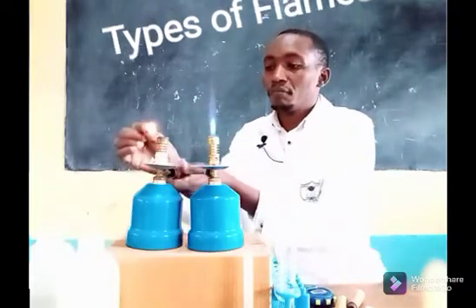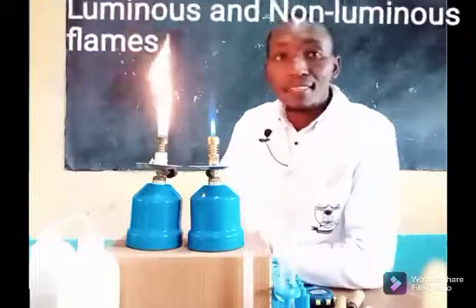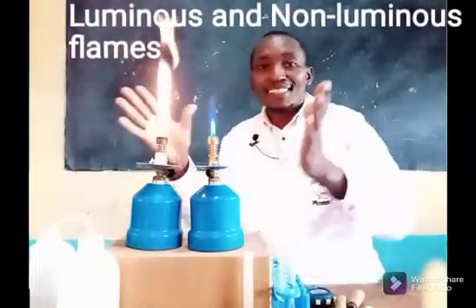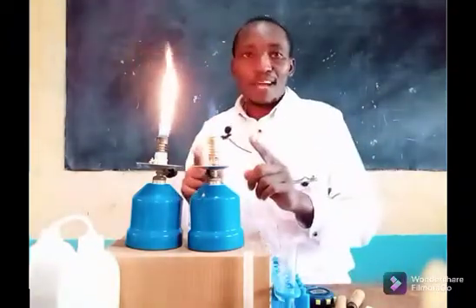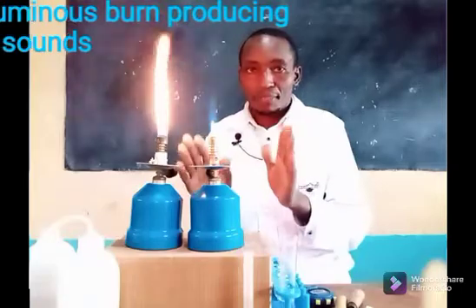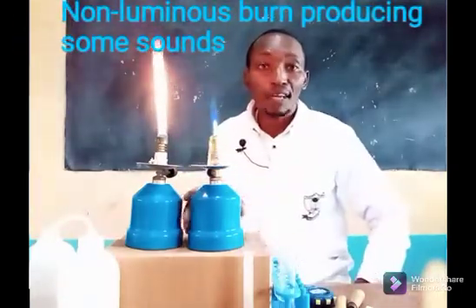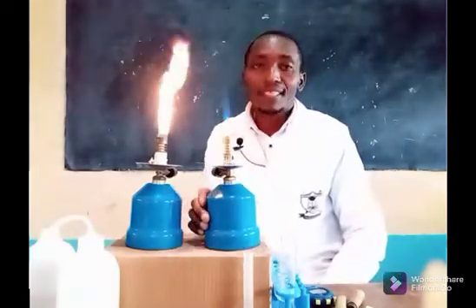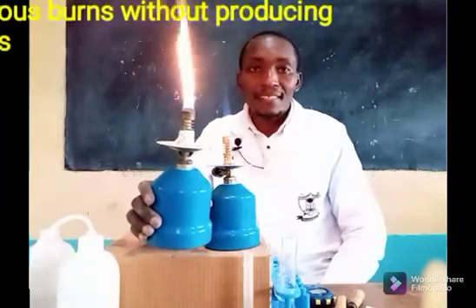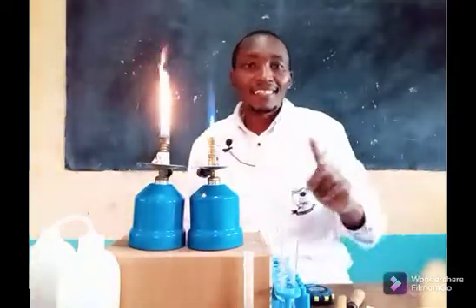That is the two flames. You can see I have two flames here. The first one — the one that is noisy, because you can hear some noise — is called the non-luminous flame. The one on my right is called the luminous flame.